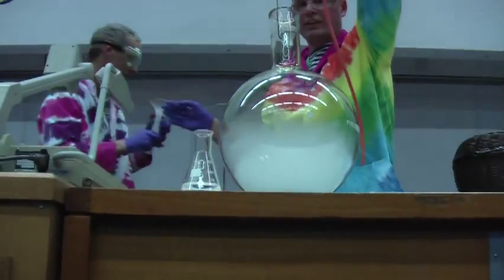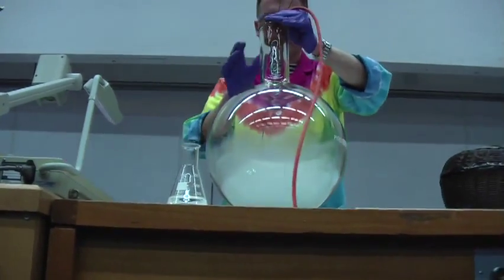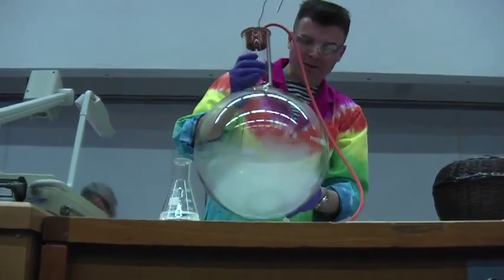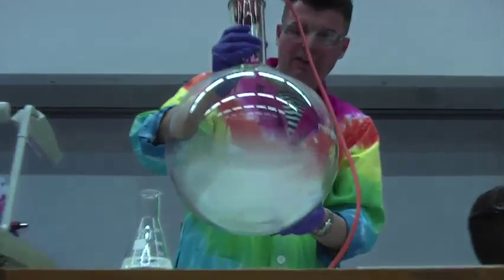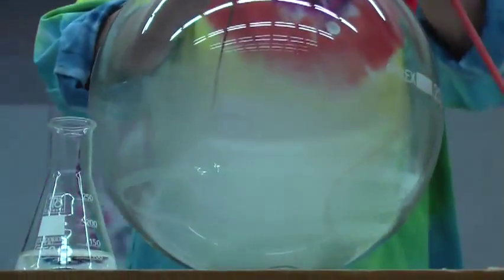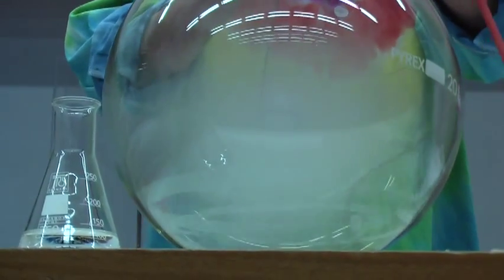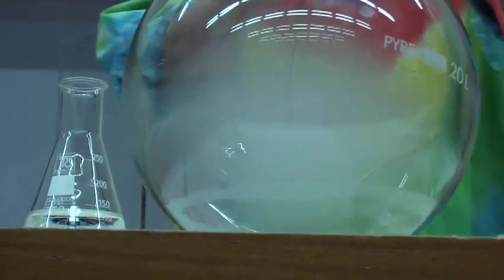Right. Now straight away, the oxygen boils. It's boiling because as far as it's concerned, the reaction vessel is 200 degrees hotter than its boiling point. So this is currently boiling away.